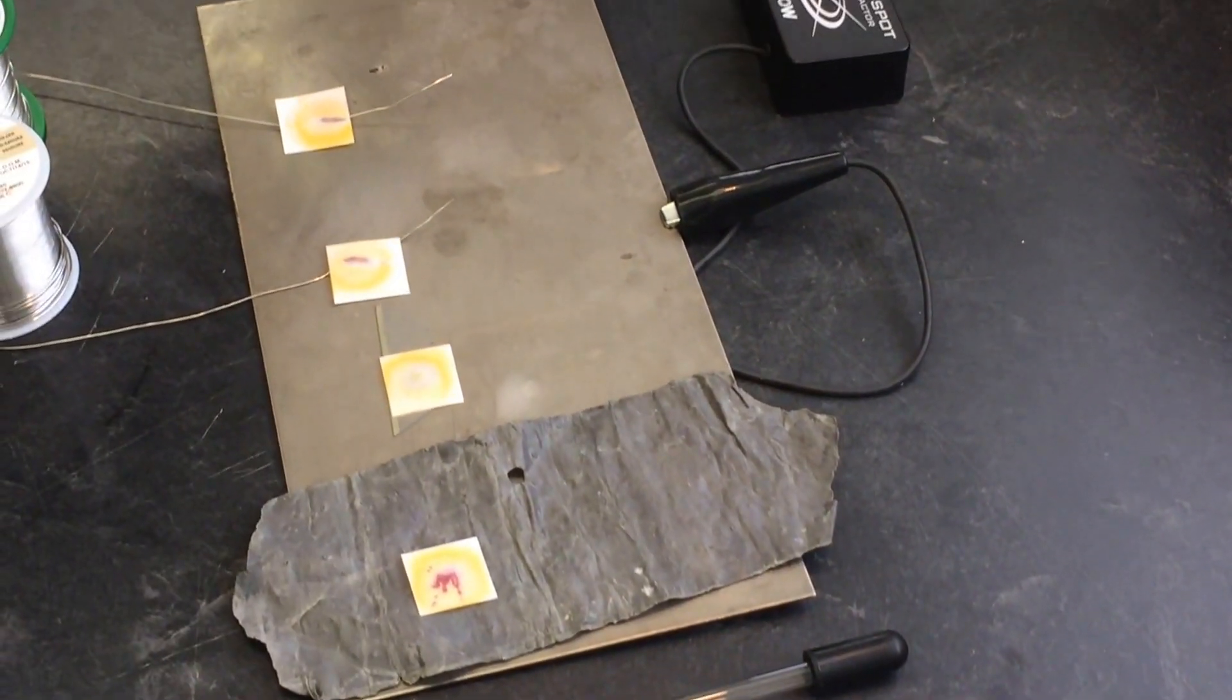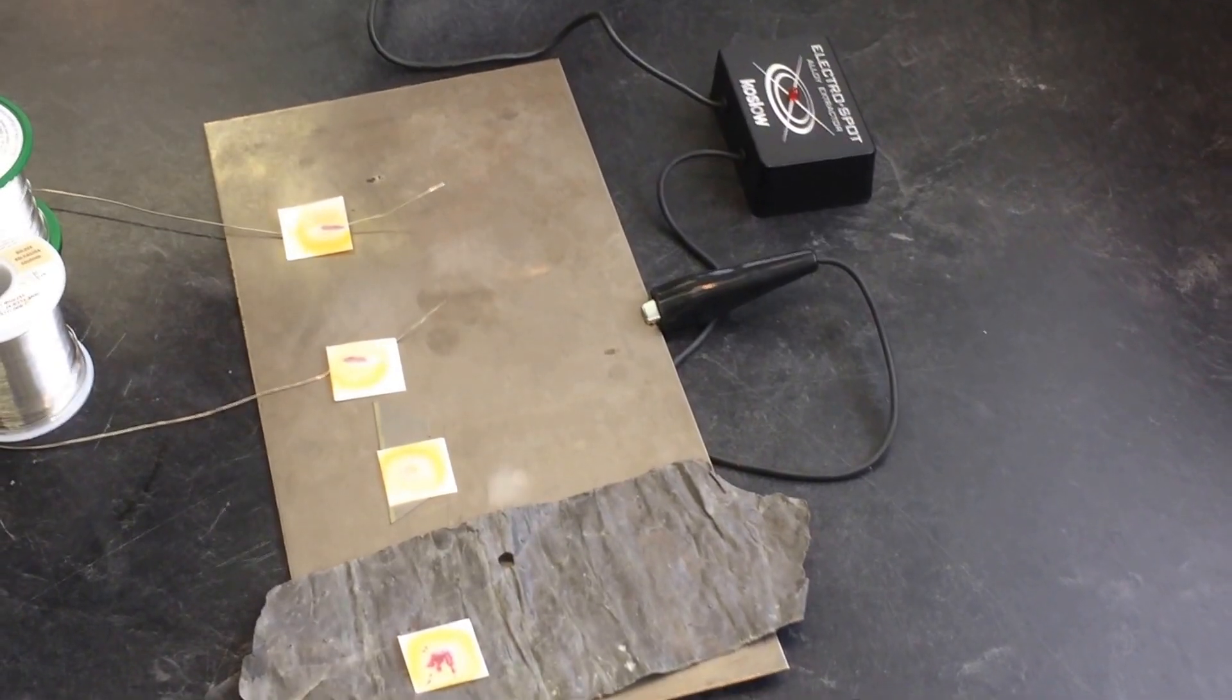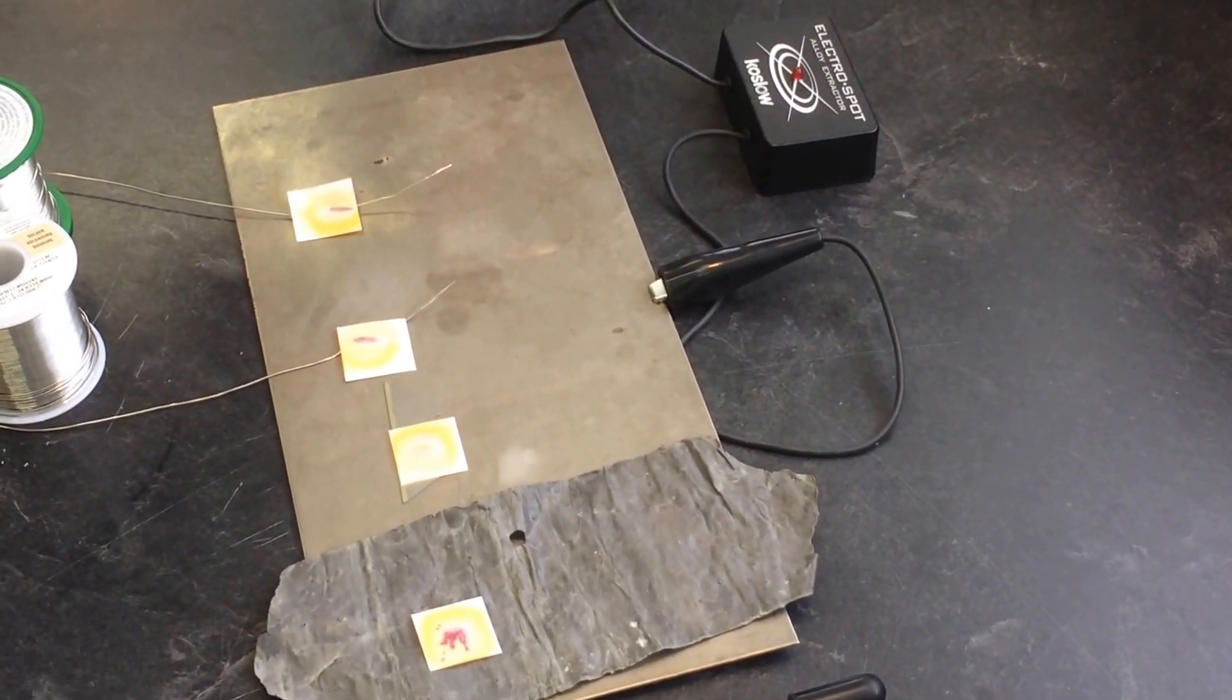But I think this test really does demonstrate that this method is effective at verifying lead content.